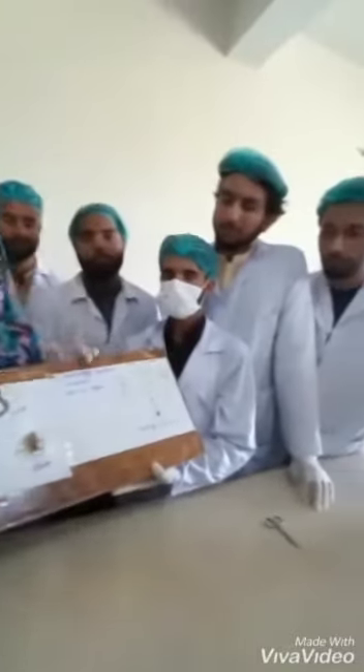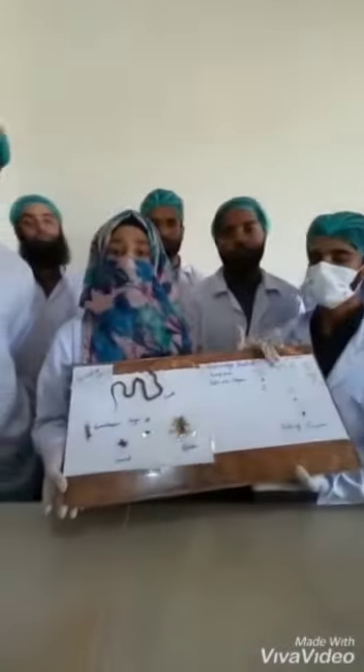It is clear from its dorsal and ventral view that, being an arachnid, it possesses 4 pairs of legs, 2 pedipalps, and a tail. At last, you can see the labelled dissected parts of the scorpion very clearly. I hope this video will prove quite beneficial for the viewers. Thank you.